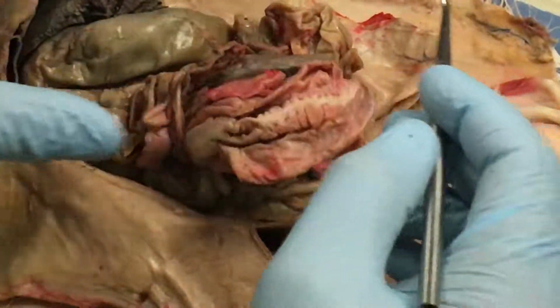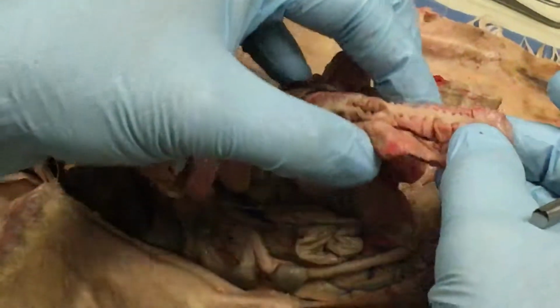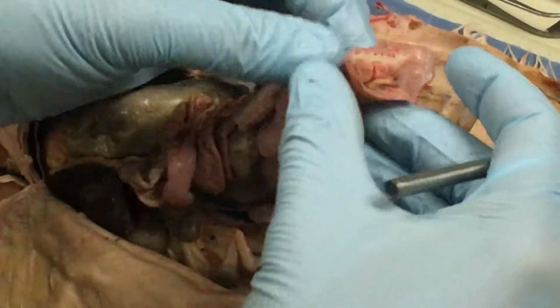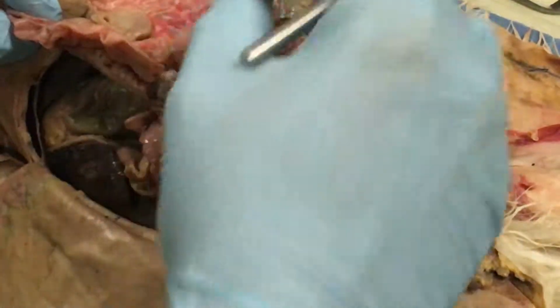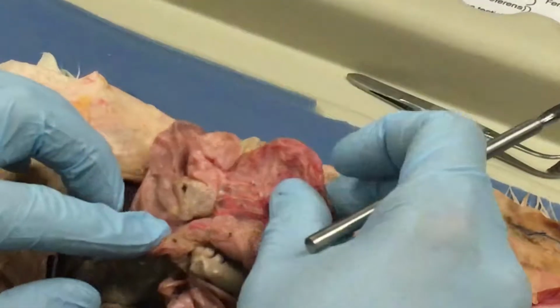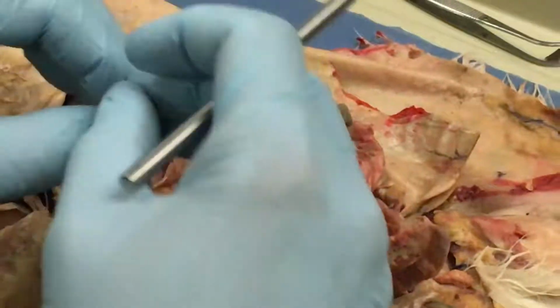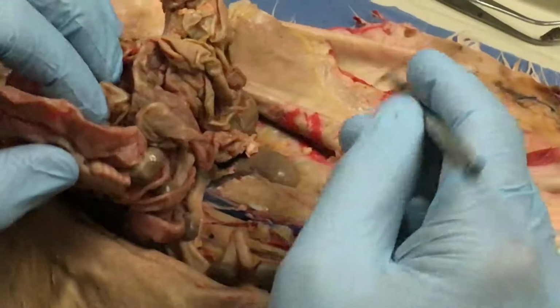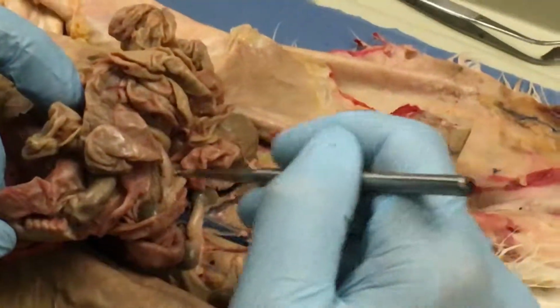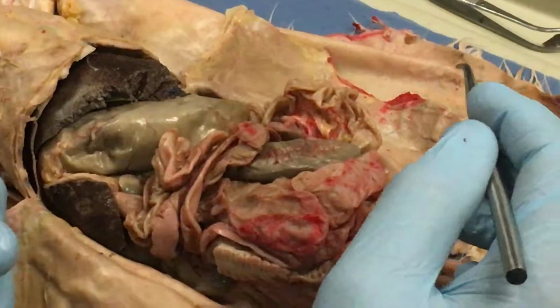Now the cecum, obviously, you're going to have to know both. Here's the contracted cecum, and then of course here's the expanded cecum. Okay, make sure you look on yours and other rabbits to make sure you can identify both, because that is an important feature of the digestive system of these rabbits. And the cats didn't even hardly have anything.